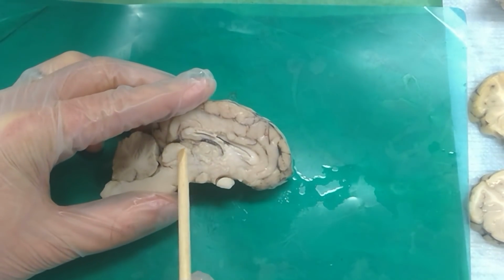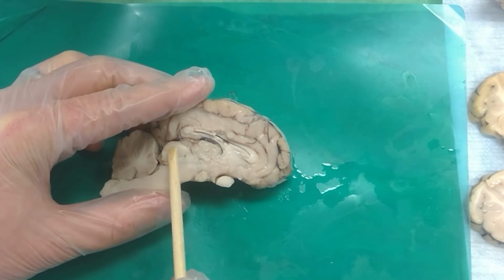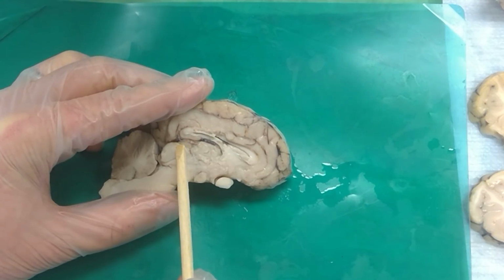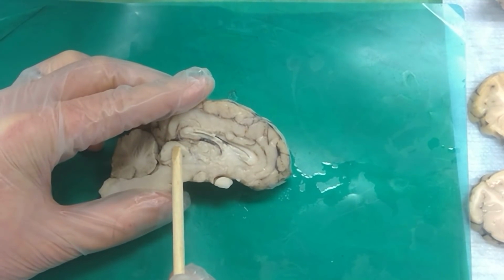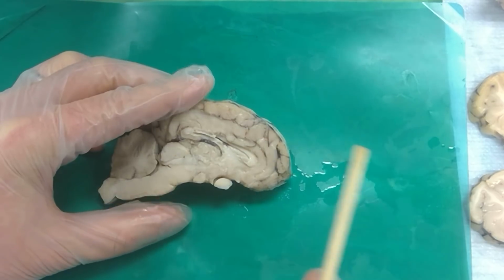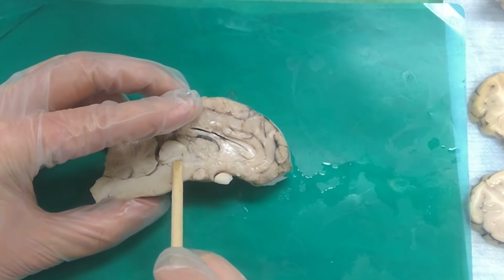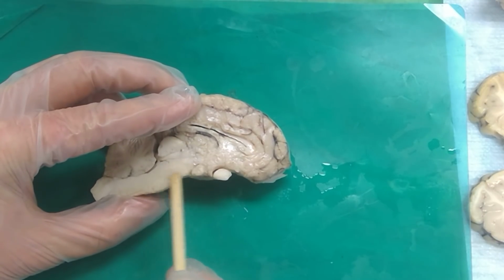And this top part right here is the, it could be the tectum if we were talking about a specific nucleus. Superior colliculus. And if we asked that on the practicum, either tectum or superior colliculus would be appropriate for naming this right here. There's a white stripe that's going through along right here. Lamina quadrigemina. The space inside the brain just below the tectum. Cerebral aqueduct. Right. And then the space below the cerebral aqueduct.